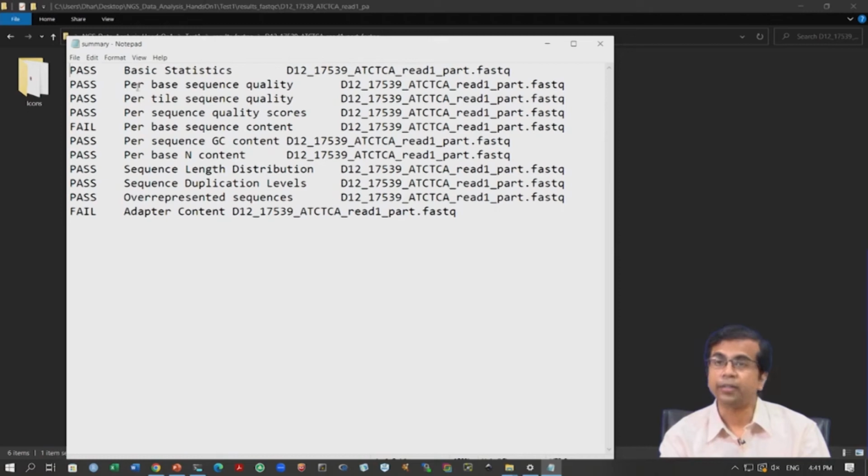This tells us whether the quality is okay based on these statistics. We talked about these statistics in the theory class, what kind of statistics you get and what they mean: per base sequence quality, per tile sequence quality, per sequence quality scores, etc. We discussed in detail what they refer to. What is important here is that for most of the statistics we see pass, so they are of acceptable quality. But for two statistics we see fail, which means FastQC has probably detected some sort of issue. This is where we need to look into the images, because those images will tell us what the problem could be. The first fail is for per base sequence content.